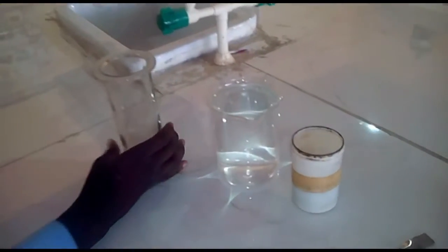Please watch. Good day, my name is Emmaus, and here with me are my classmates. Today we are going to be carrying out an experiment on diffusion. Once again, diffusion is a movement of particles from a region of higher concentration to a region of lower concentration. The first is a gas jar, the second is distilled water, then potassium permanganate crystals and a spatula.